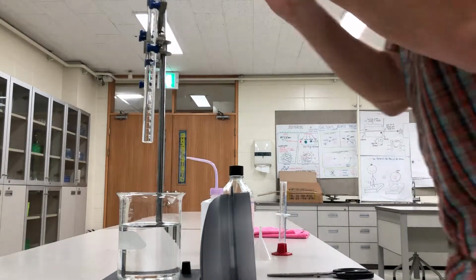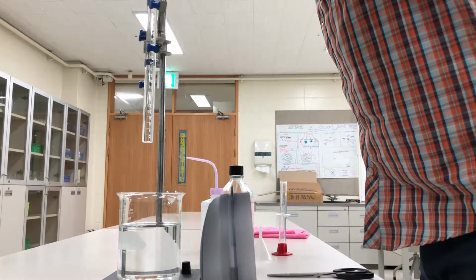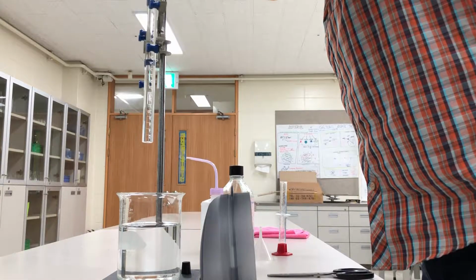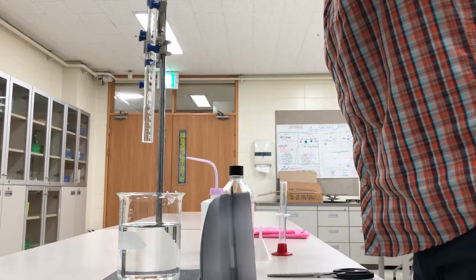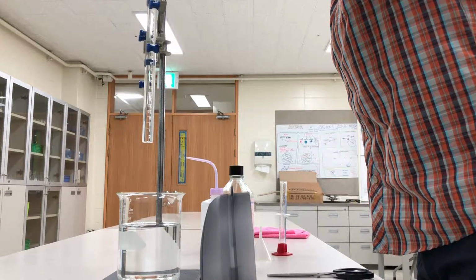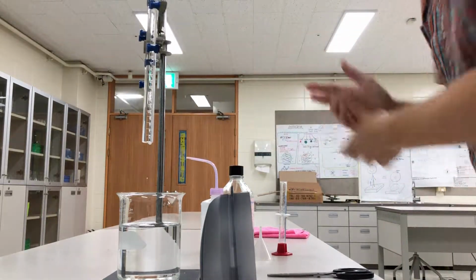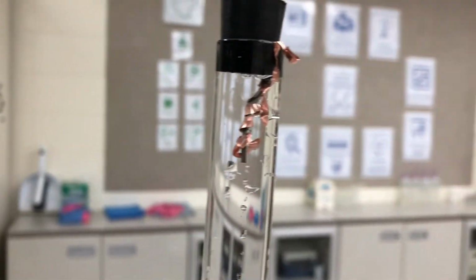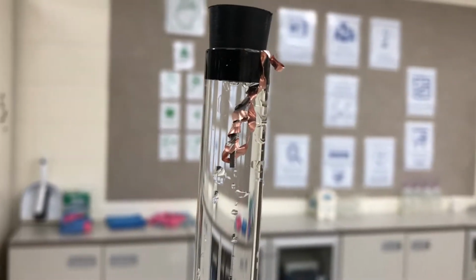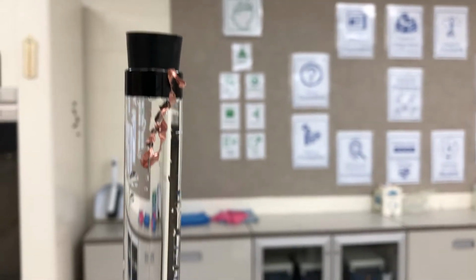So I'm going to affix this in here. And I know that on the screen you can't see it right this second, but bear with me, you will in just a second. You'll see what's going on. Okay, so let me wipe my hands, and now let me zoom in so you can see. All right, so here's what I've done. Now, there's the magnesium in there. It's caged in the copper. I've put it into the water. Now notice there's no air in here whatsoever.